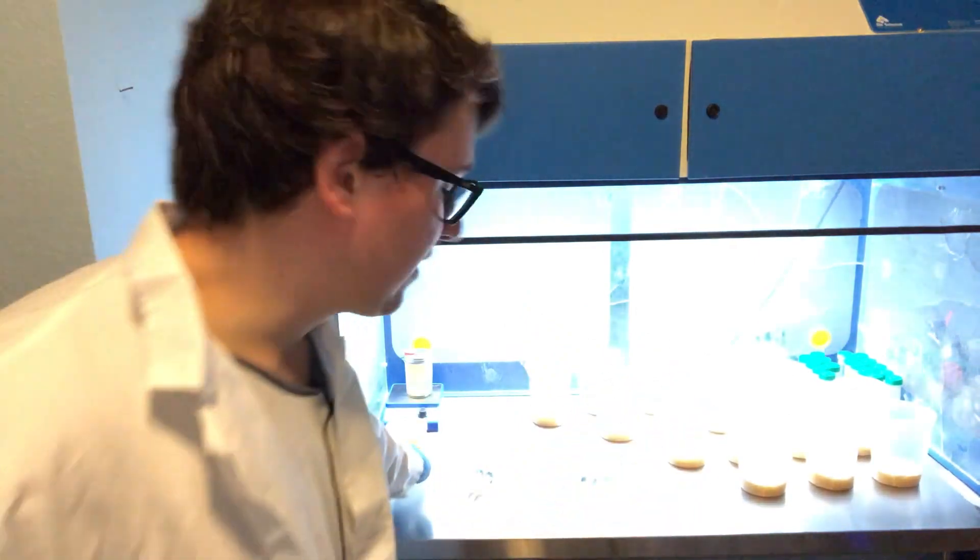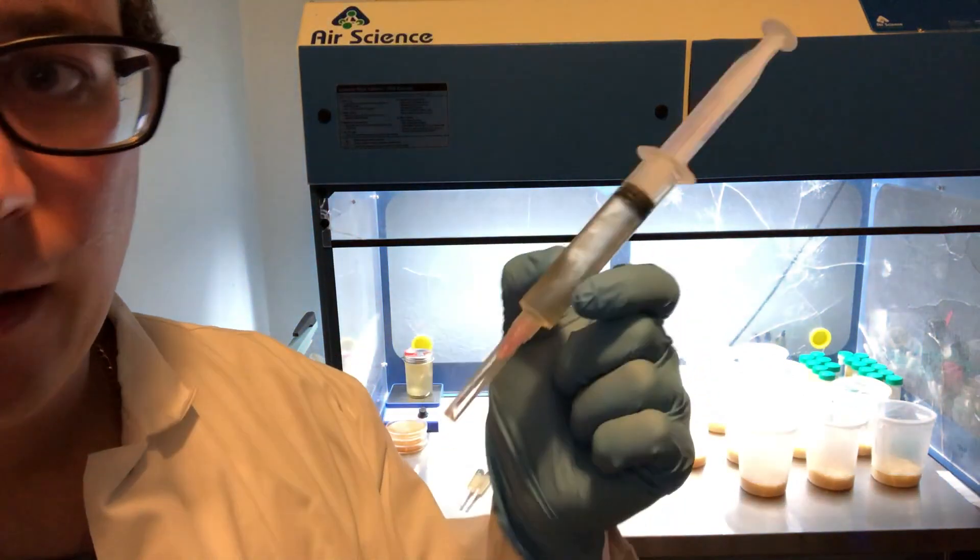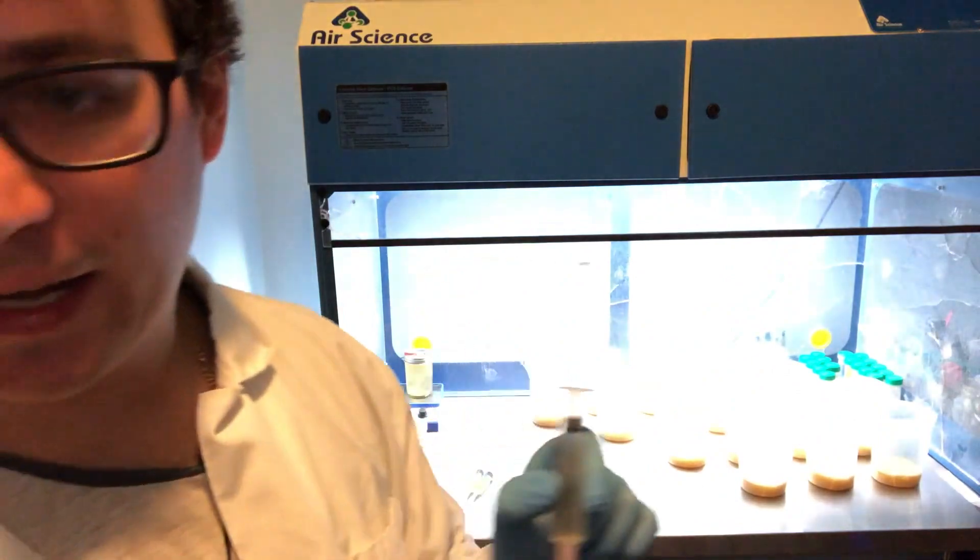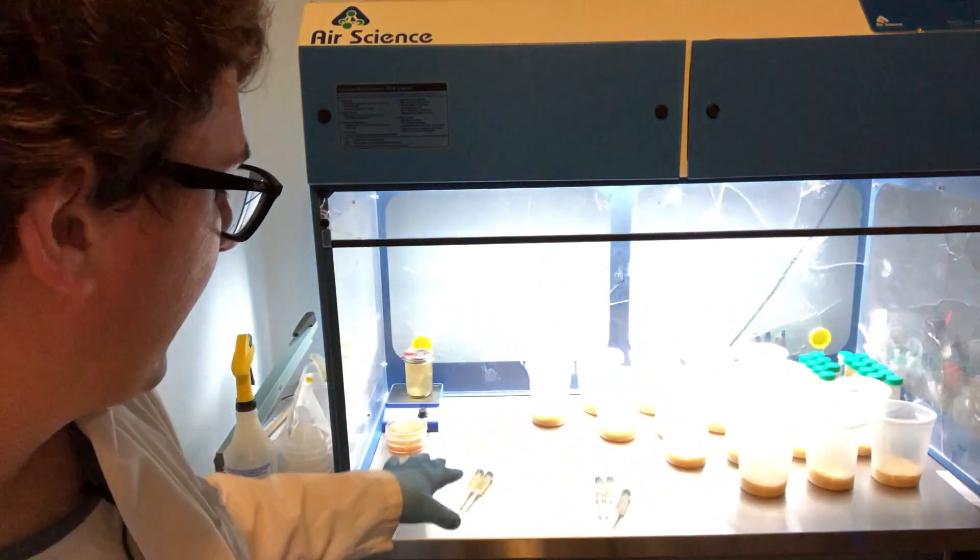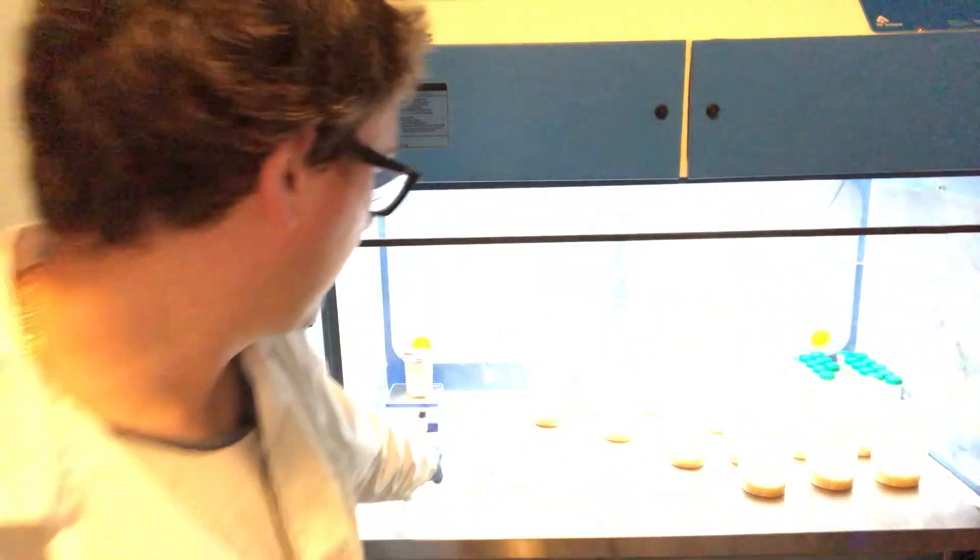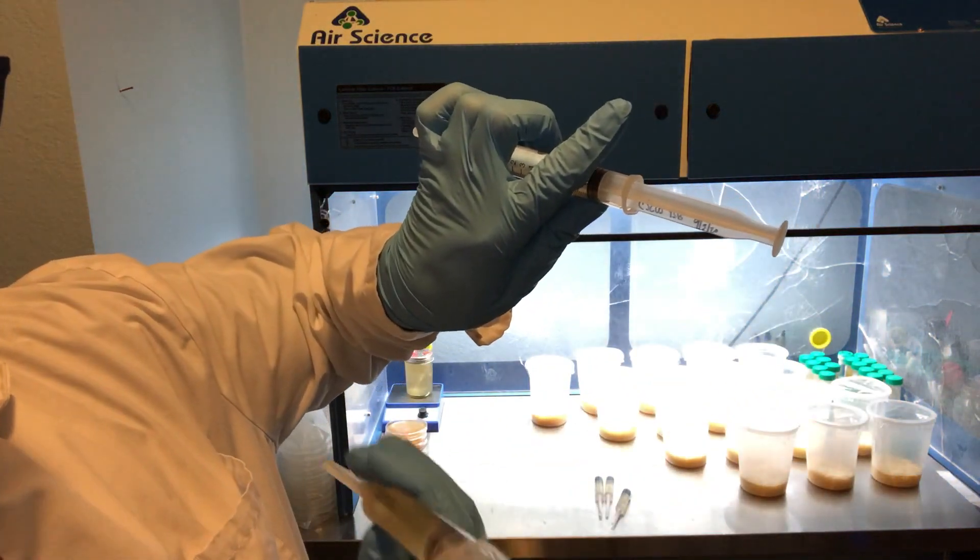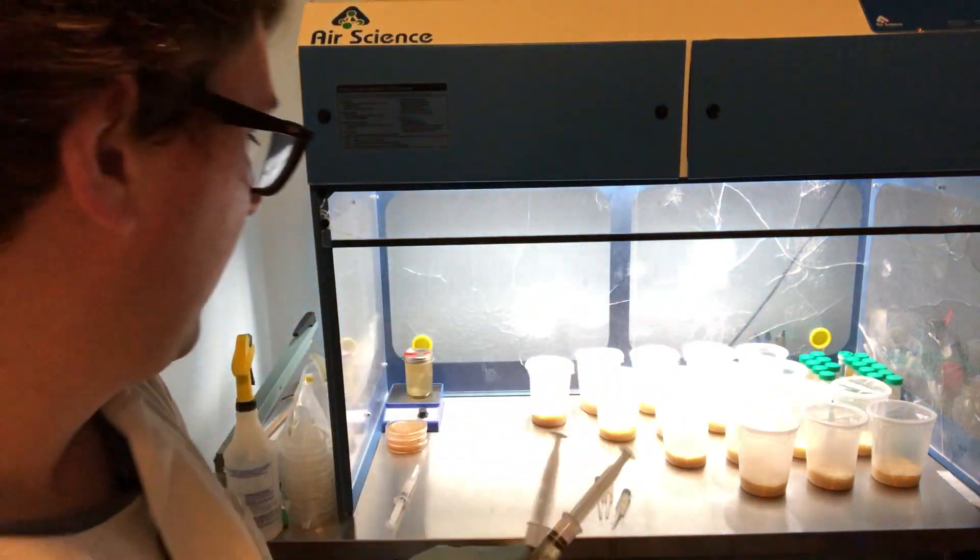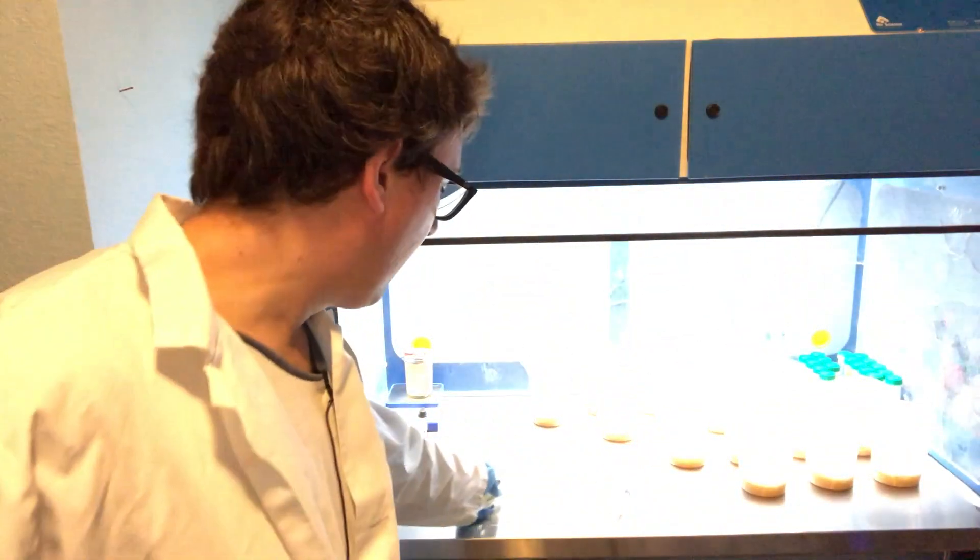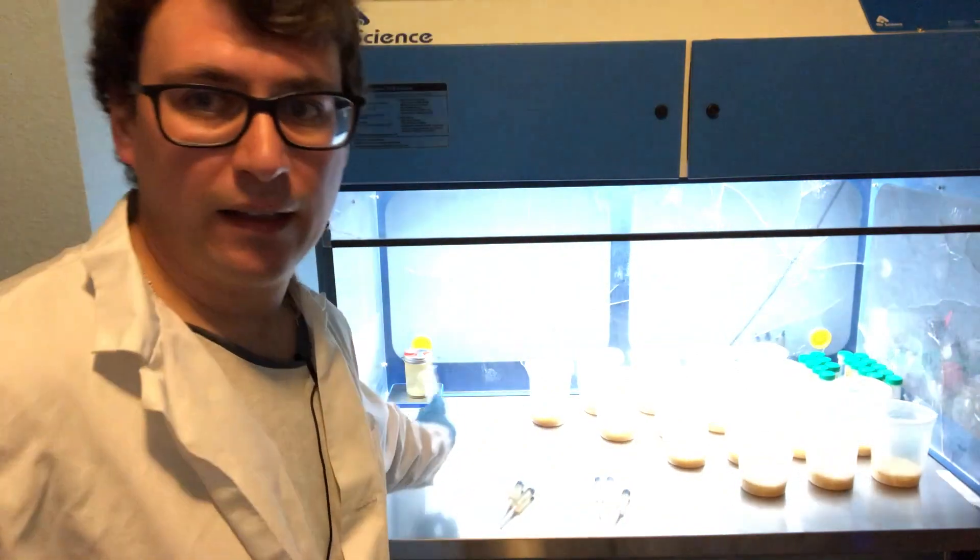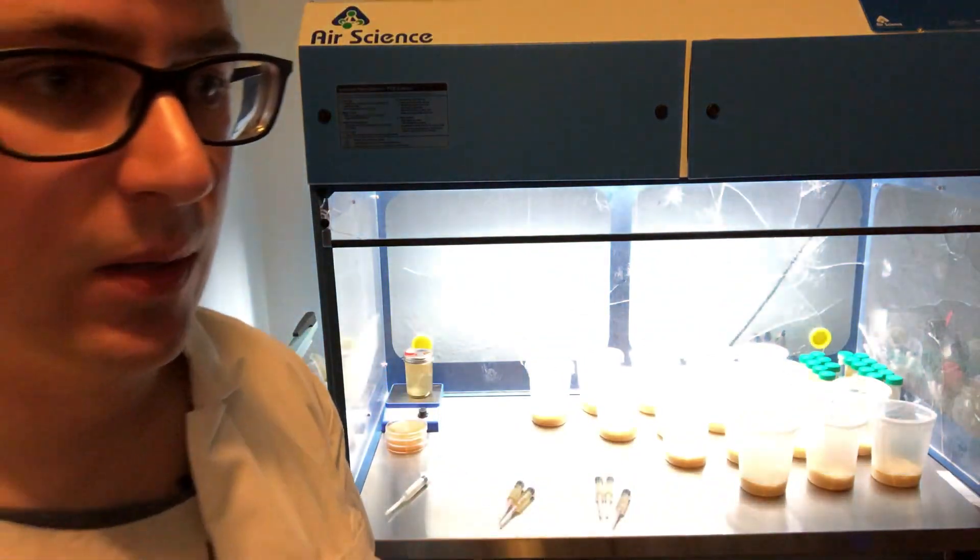I'm going to be inoculating this one against two of the strains that I bred previously on my first Cordyceps project, and then also I've got some more of the UK United Kingdom Cordyceps that colonize really well there. So there's a wild clone and then two of my back crosses, the C3C10 and C3C8, and these are from September so they're a little bit older.